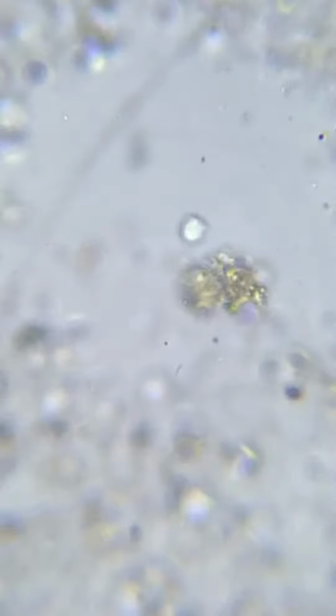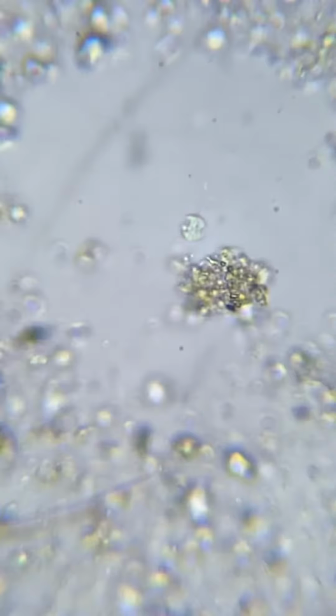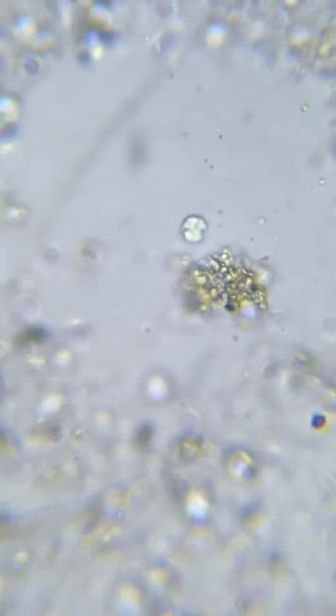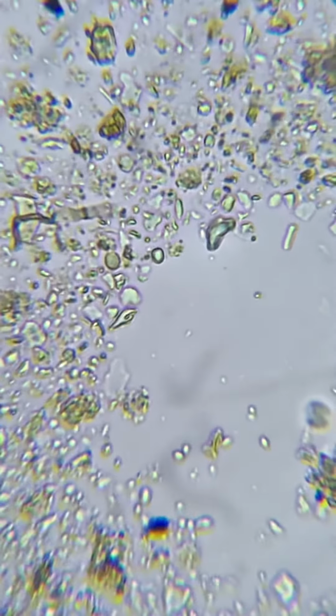You know, because maybe it's a flagellate, but they usually don't move the debris like that. Not that orderly. They're kind of bumbly, as Elaine says. And who do we have up here? Is this anybody? Nope.